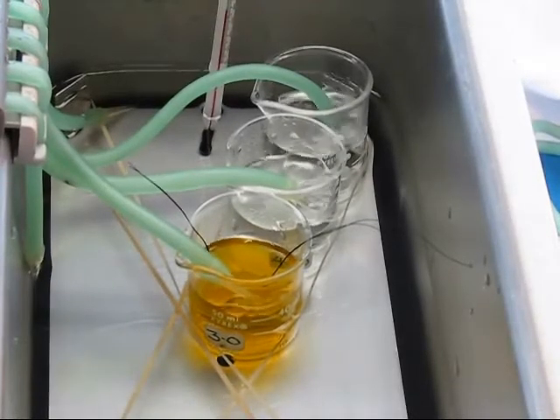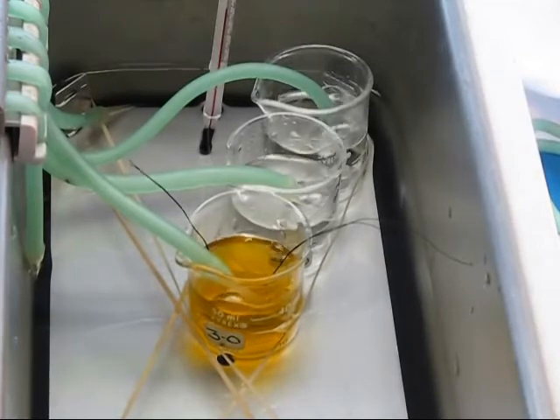If you discover any leaks from the intestine, tie off the leaky section and do not use it for your experiment. Leave all sacs to incubate this way for one hour.